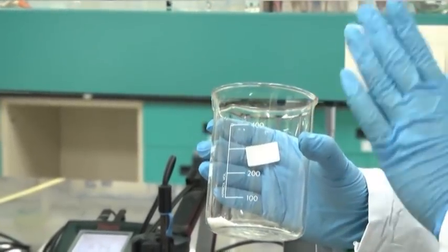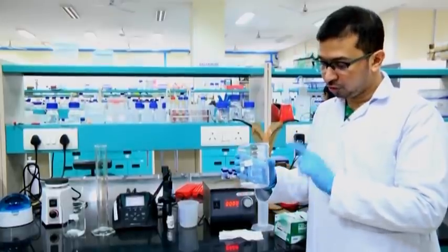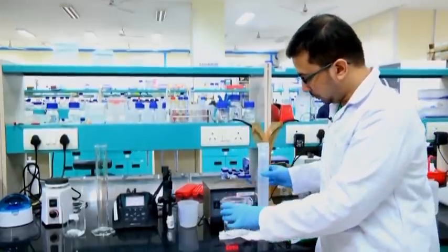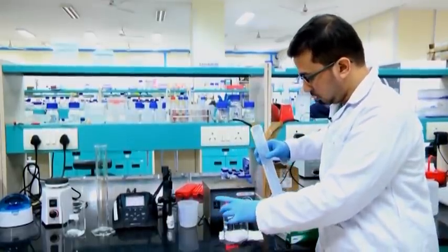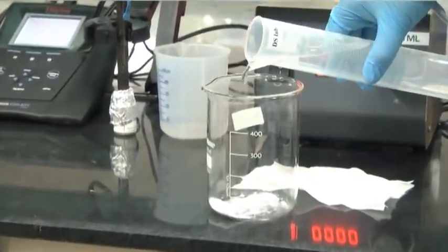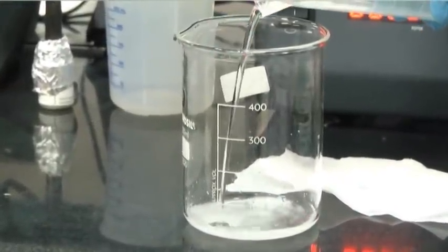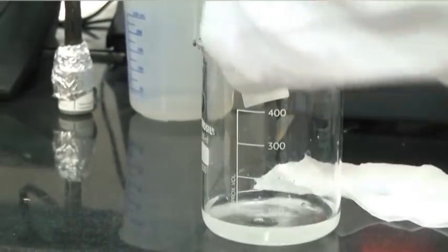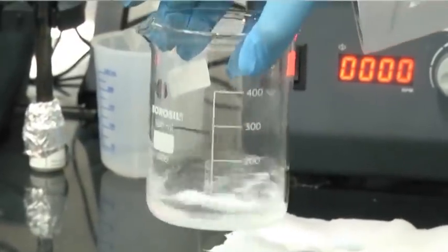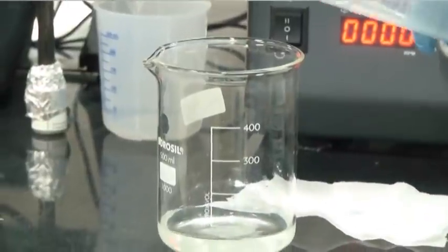Generally take the graduation mentioned in a measuring cylinder, which you will do later on after dissolving. So we will basically fill this up to roughly 200 ml. For that, we will add here.